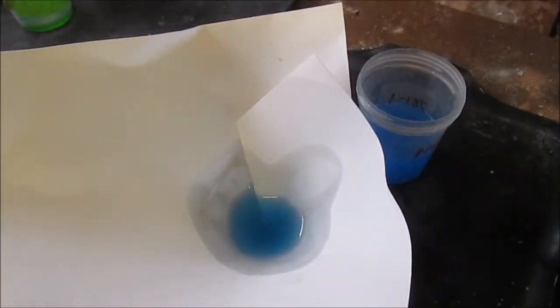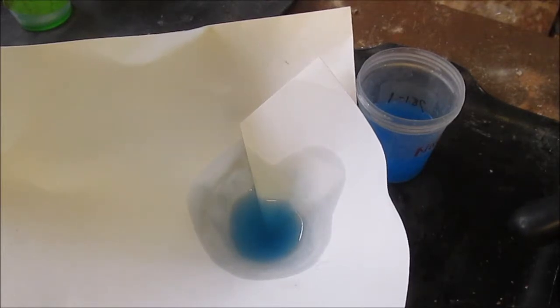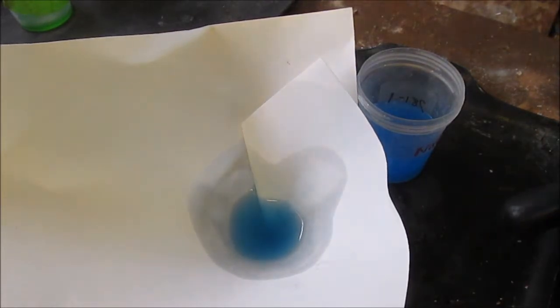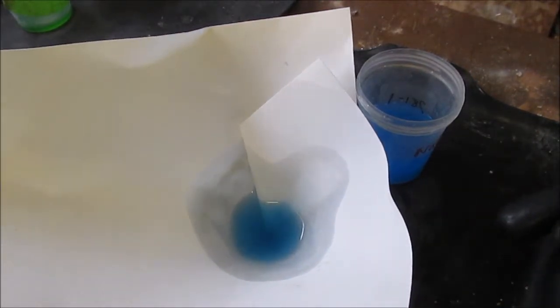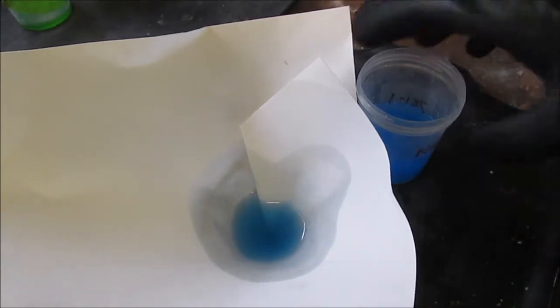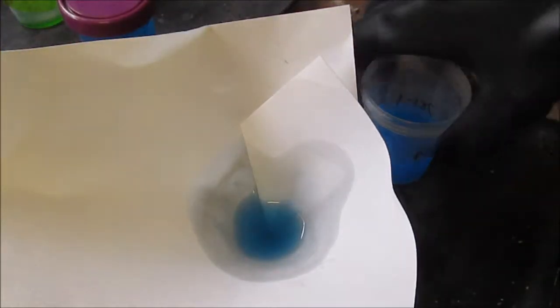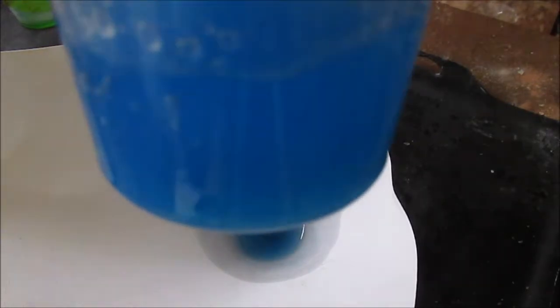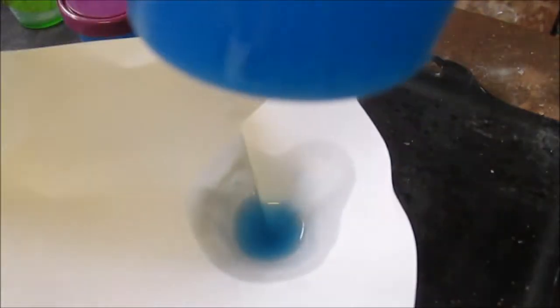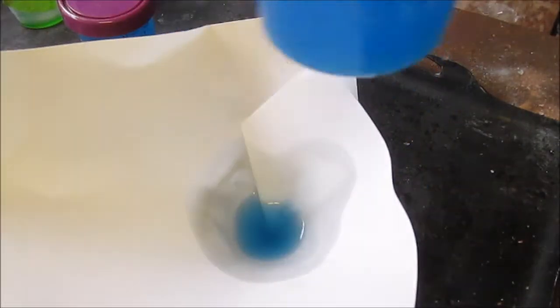I mean, of course there's some copper sulfate in there that is naturally blue, but a lot more of the color comes naturally from the suspension of copper hydroxide crystals. Which you'll notice, here is a solution of copper sulfate. It's very clear blue, turquoise. And then here's the suspension of copper hydroxide. It's a similar blue, but darker and very opaque.